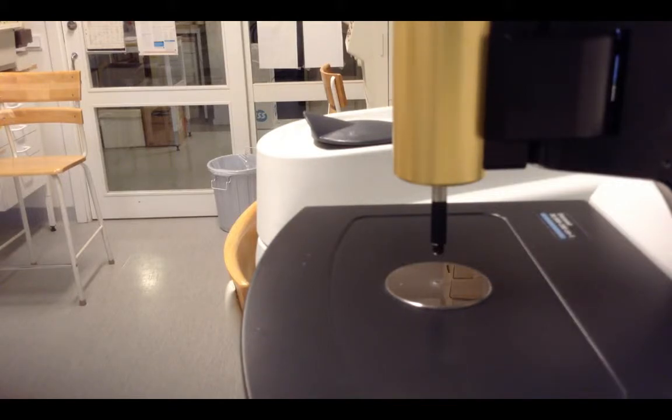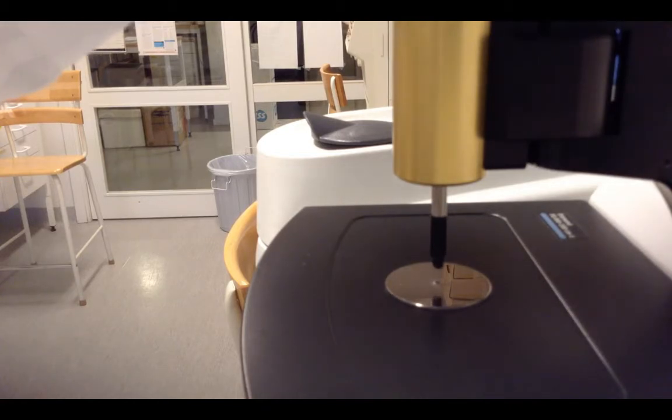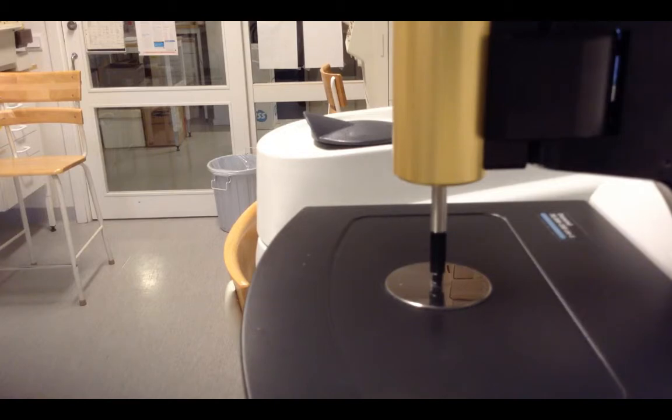Now I'm going to show you how to load your sample to do an experiment. But before loading your sample, you usually need to do a background measurement or background scan. You just need to mount your tip to the diamond and run the software to do a scan to see the background and check the status of the background.